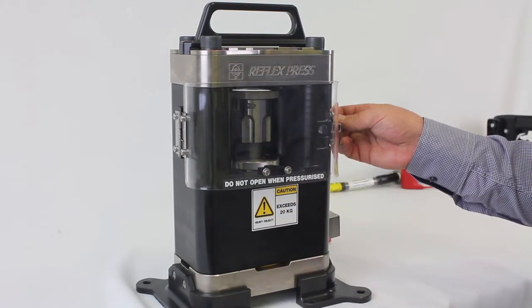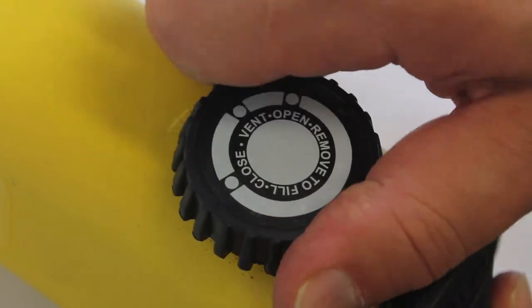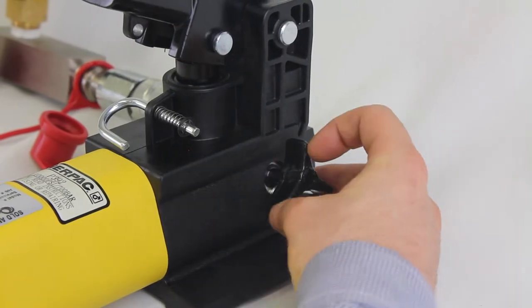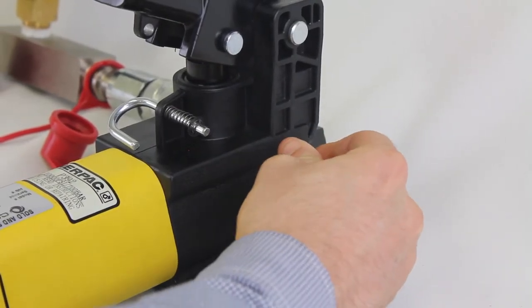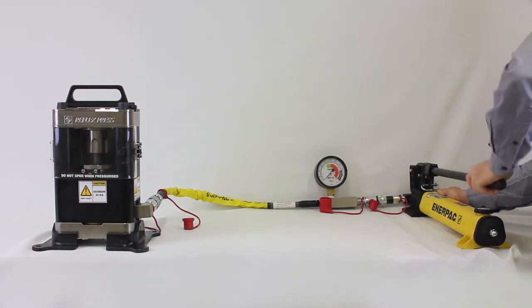Turn the cap to vent. Unlatch the handle locking mechanism and ensure the pressure relief valve is closed, and begin to pump. Use full strokes of the pump when pumping to ensure the second stage of the pump is activated.